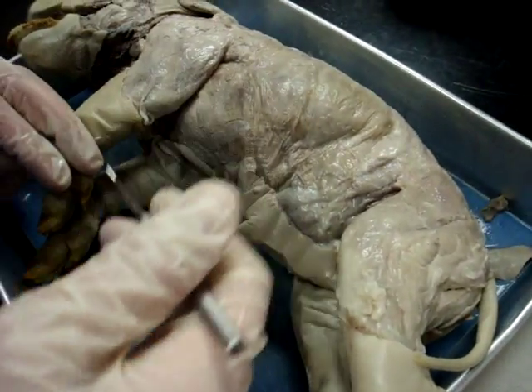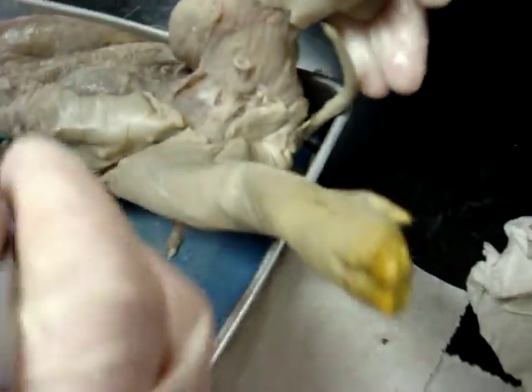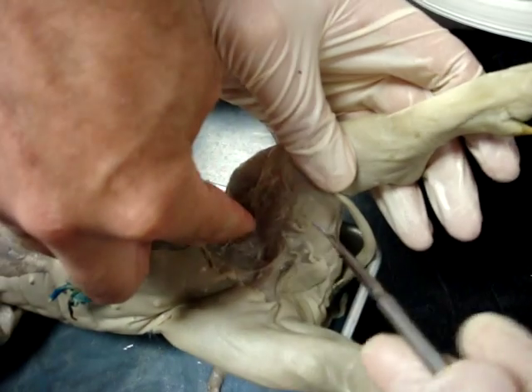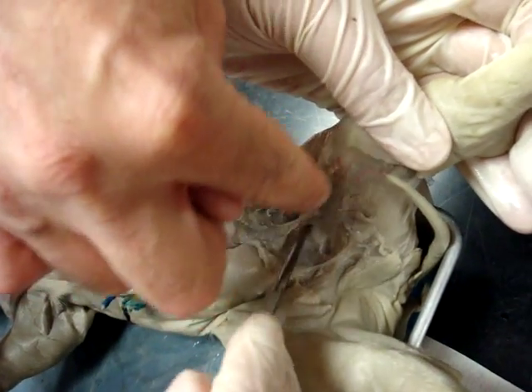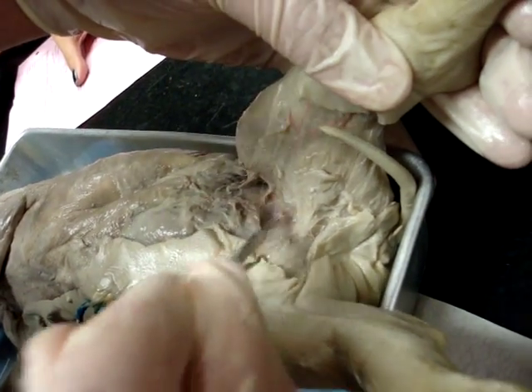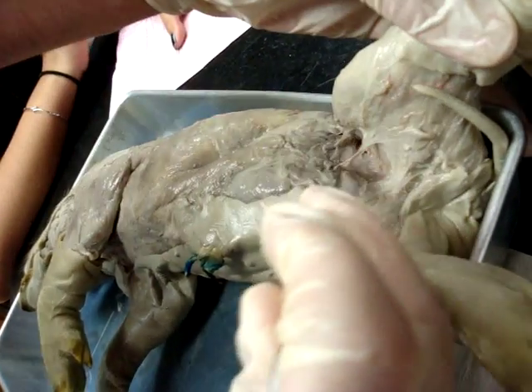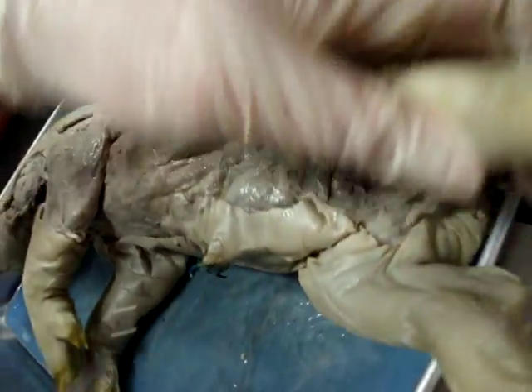What was the sartorius again? Sartorius — I always think of Aquarius when I do sartorius: 'This is the dawning of the age of Sartorius.' Okay, sartorius is in the middle — it runs this way through here. If you cut this out, it's literally in the middle. When you get rid of the fascia that's all sitting there, you'll be able to see it better — it'll be the line right here, just like on the frog, in the exact same spot.